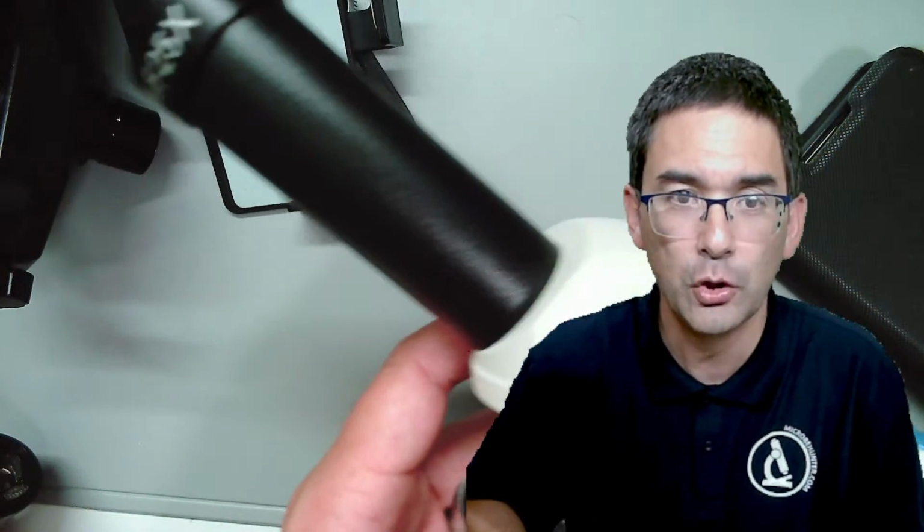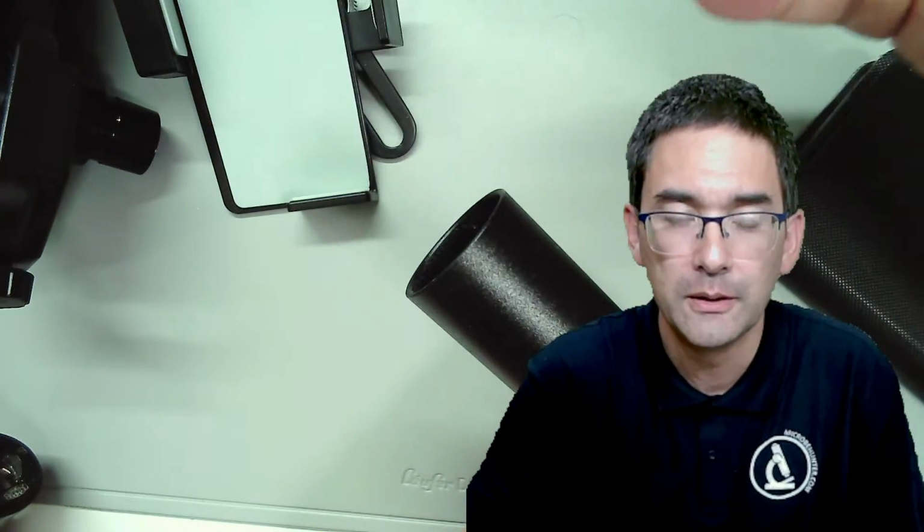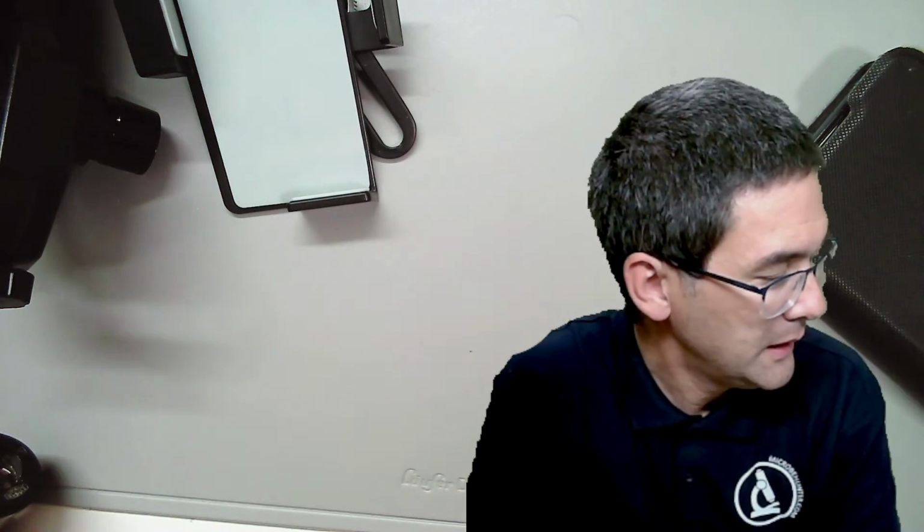Okay, you see some microscopes don't have a trinocular head, and these are introductory microscopes here, so you can easily connect a mobile phone here instead of this eyepiece. So this is not a problem. I need to put it away. Okay, so that's clear. So let's move on a little bit.